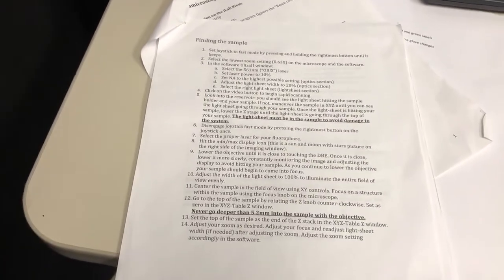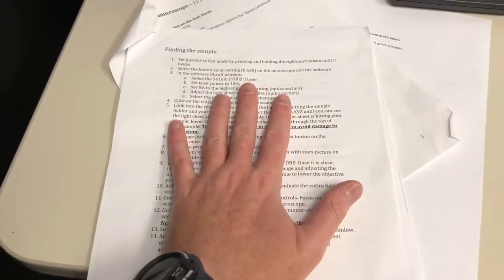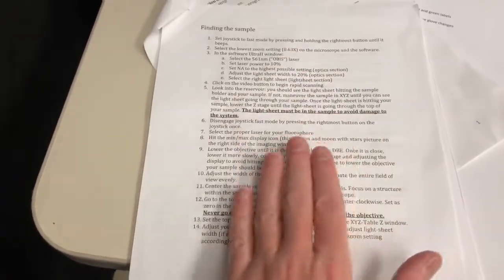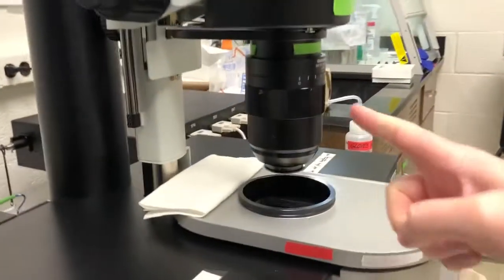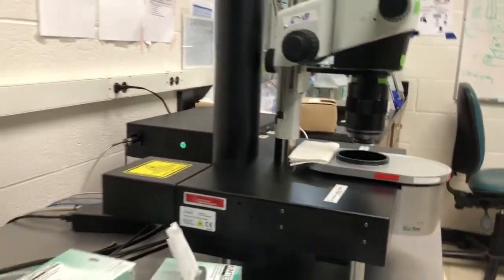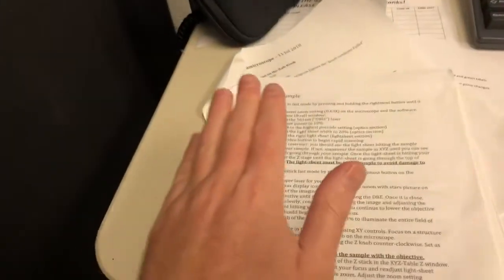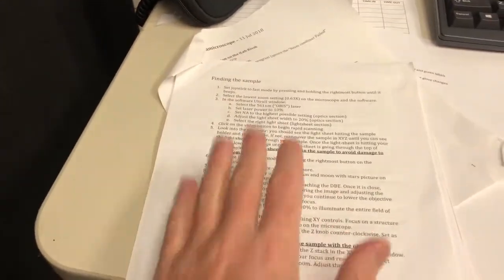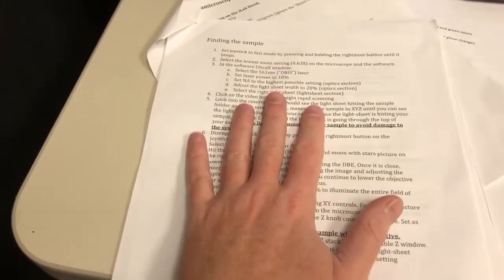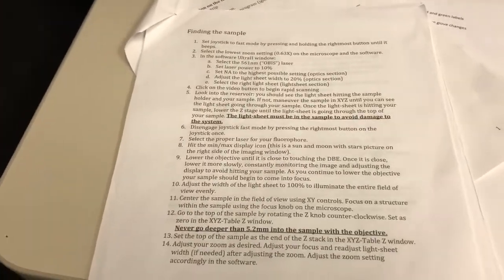The rest of the instructions are more of a reference — they explain how to do various different workflows. But this section is critical to follow because it minimizes the risk that you will slam the objective into the sample, which is one of the two main risks to the integrity of the system. If you do things this way, the risk of that happening is very low. Please do it this way, particularly when you're just starting.